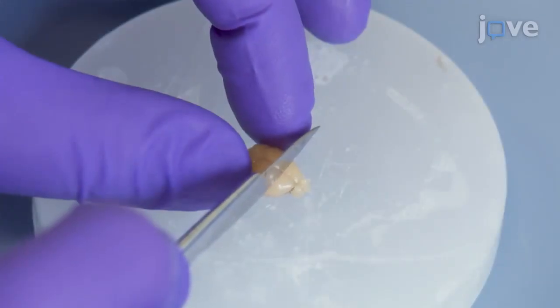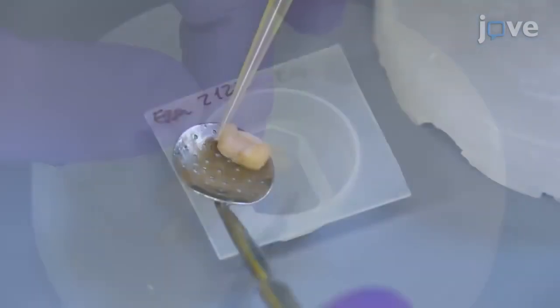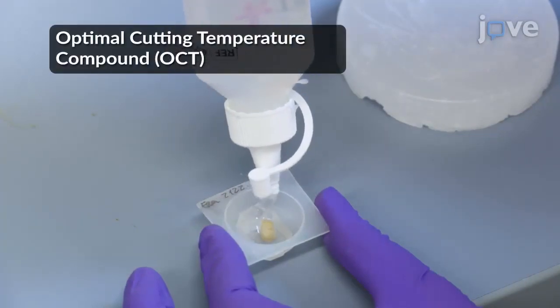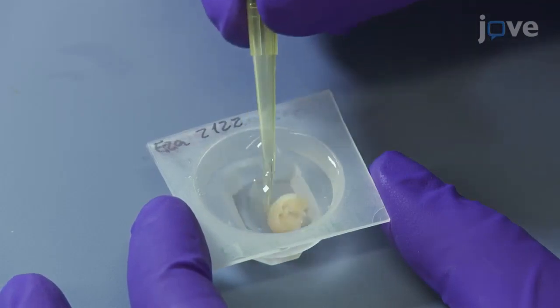After that, use a sharp blade to trim the cryoprotected brain depending on the area of interest. Then place the brain in a cryomold and add optimal cutting temperature compound to embed it, making sure to avoid bubbles, and orient the brain properly so as to have a coronal plane of cutting.